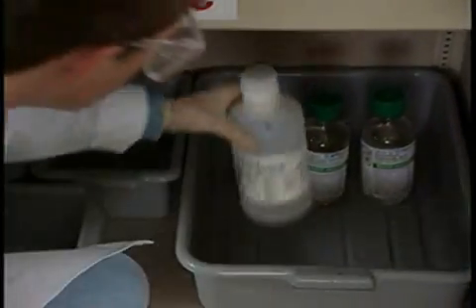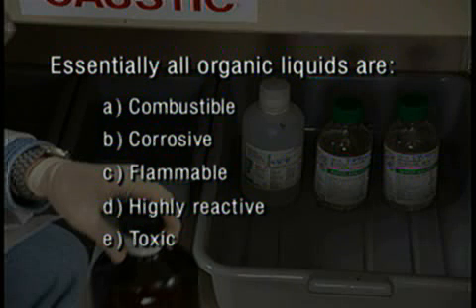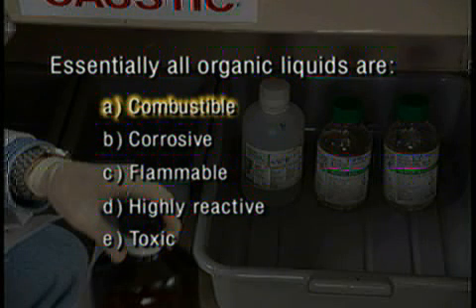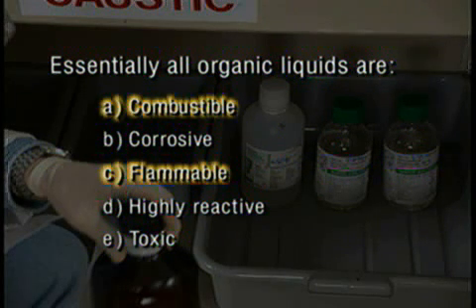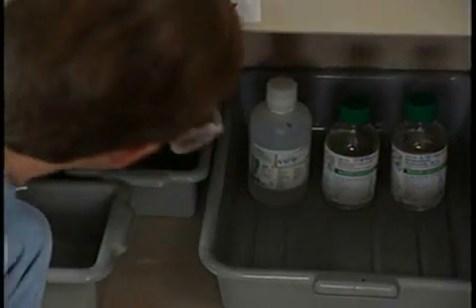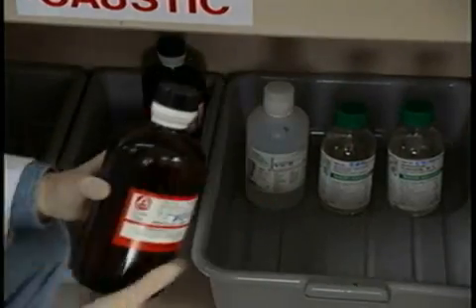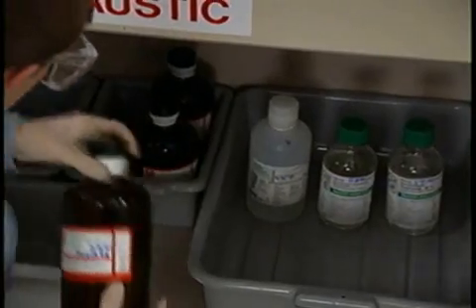Regarding the hazards of organic chemicals: combustible or flammable — most organic chemicals will burn. However, flammable liquids can ignite at or near room temperature. Note that Lisa and Mario place their liquids on lower shelves. If something ever leaks or spills, they'll be glad to have it come out below eye level.